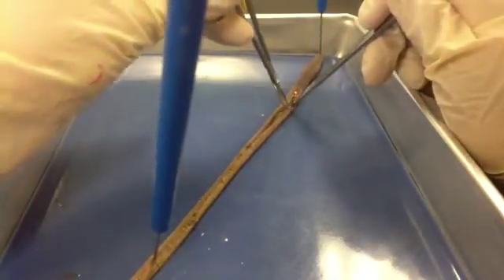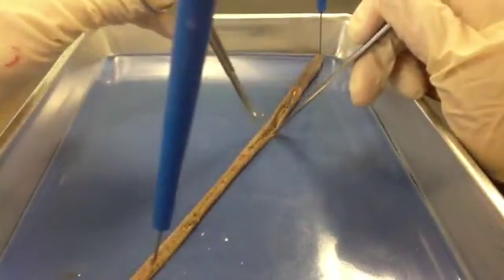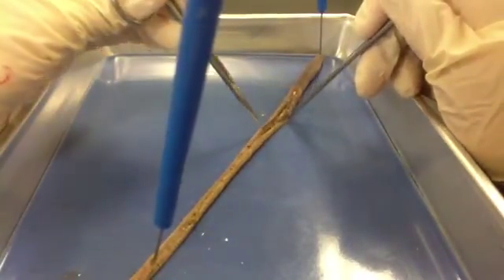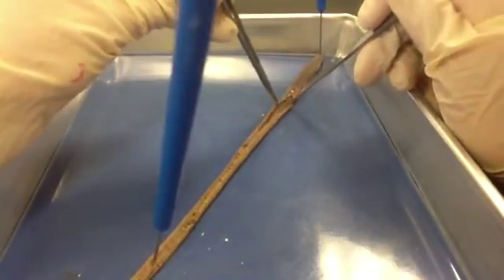Let me open up what I've done so far. You can see the intestines as we go through. If you go too far, you might pierce the intestines and topsoil will come out, which is just this black gooey stuff. If you want, you can use more pins to kind of pin your earthworm open as you go. As you get to the clitellum, be very careful not to cut through any of the other organs.